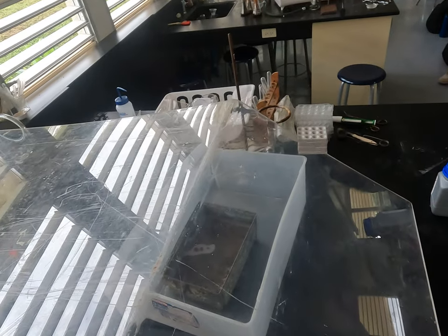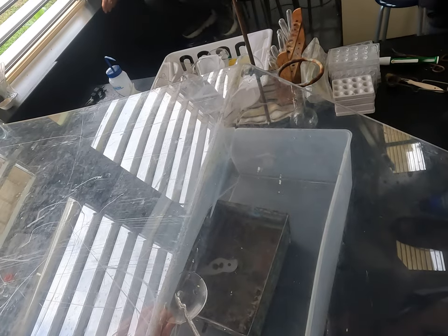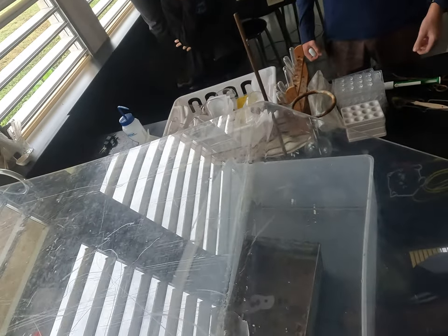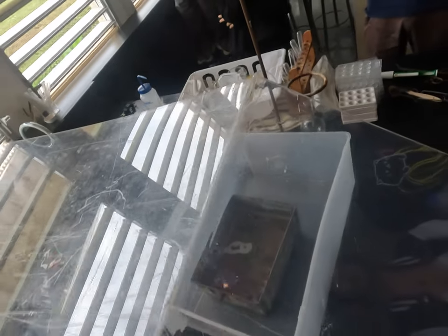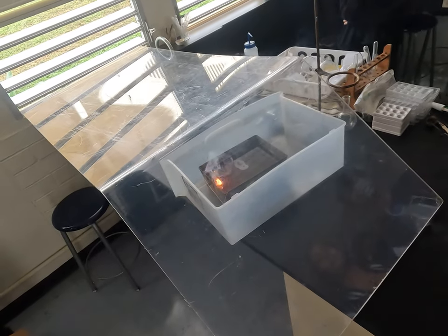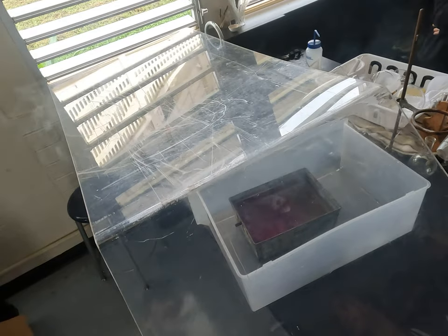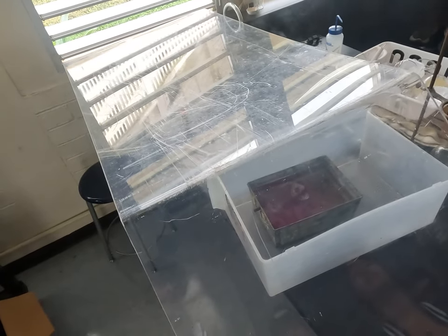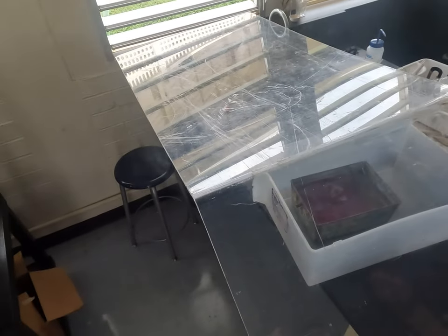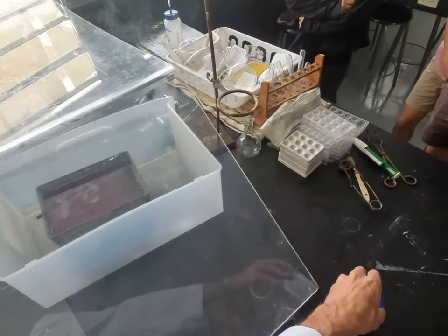So I set up this shield — maybe on the shield side of this. So what happened? Can anyone see what happened to the water? It's purple. It's purple. So the pH went up.